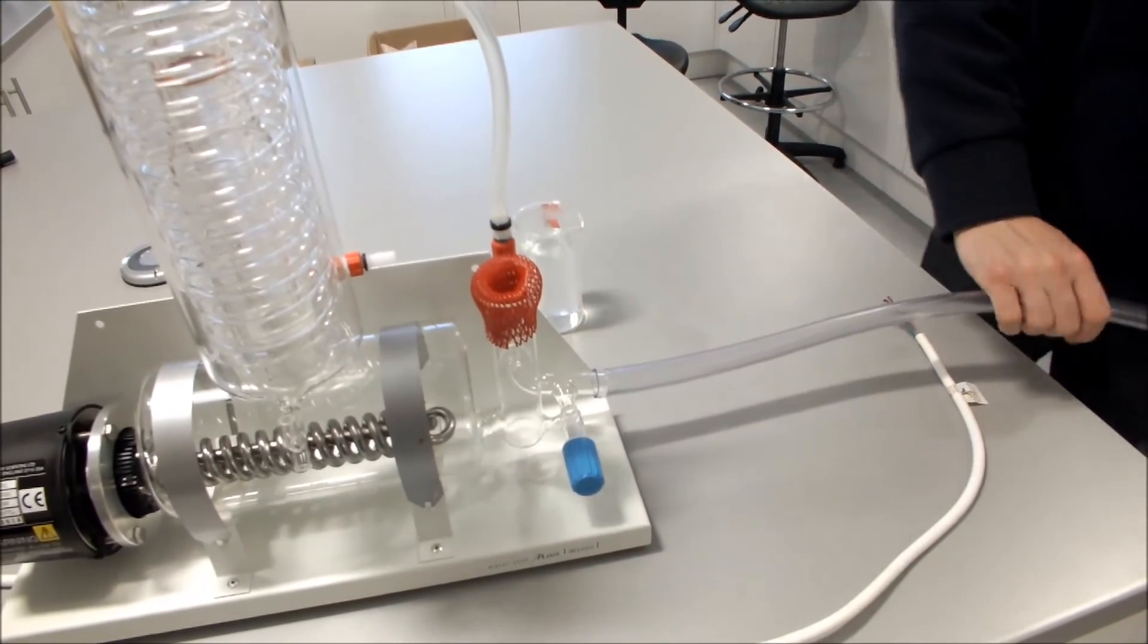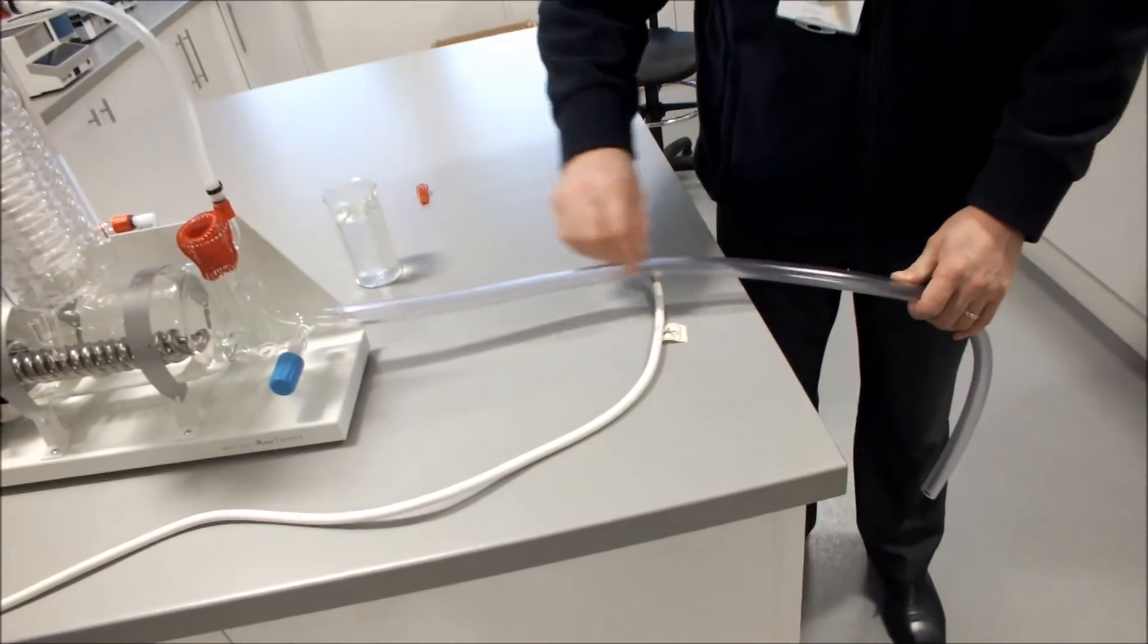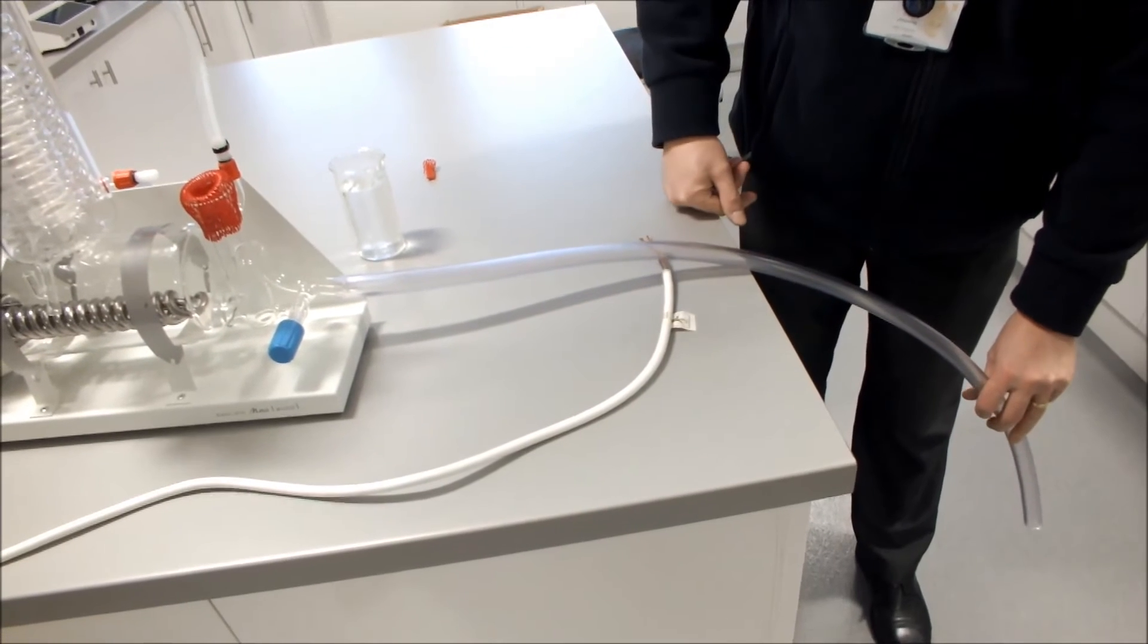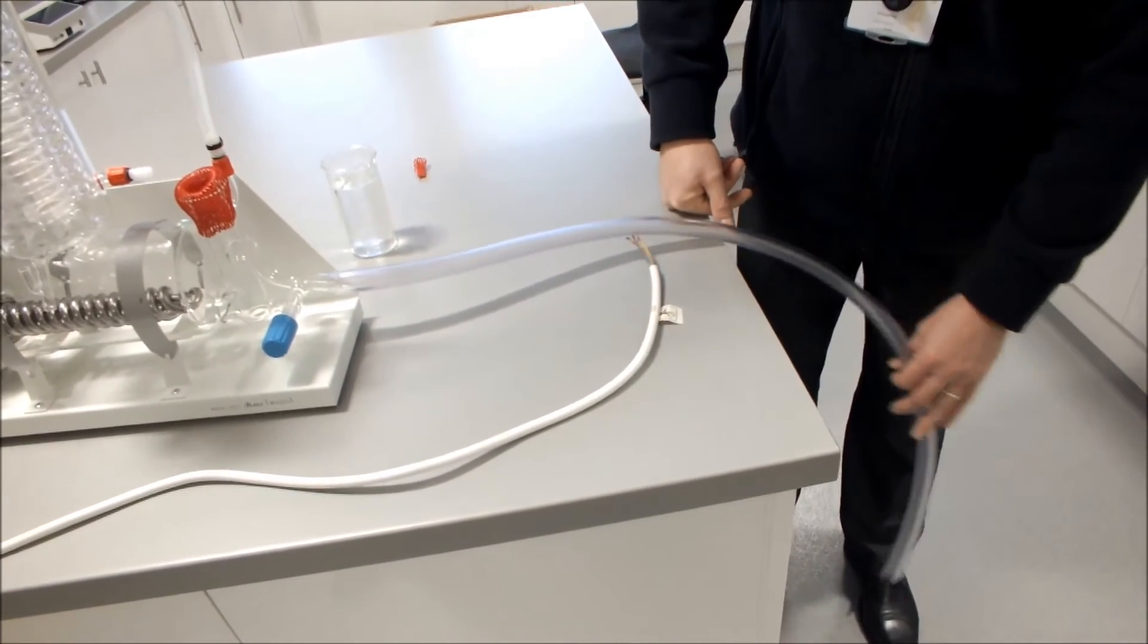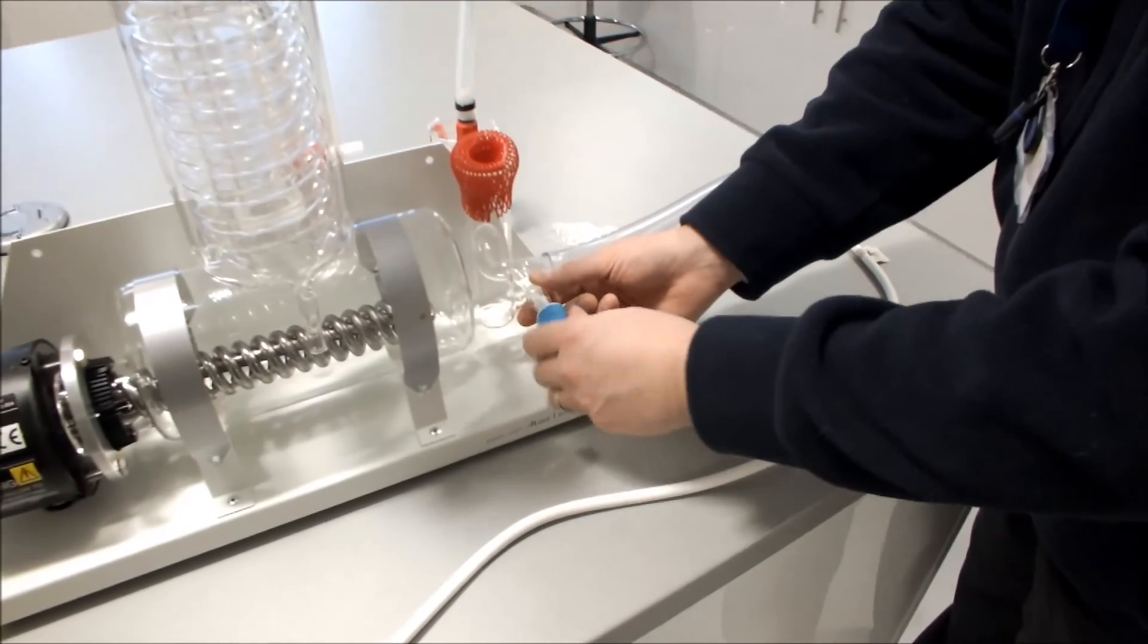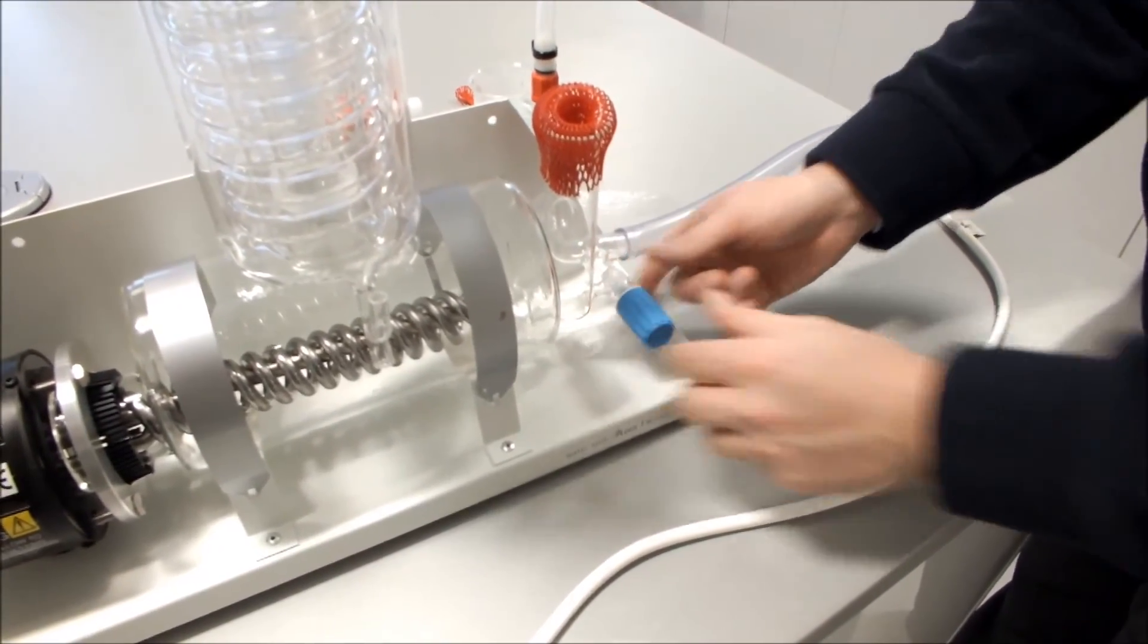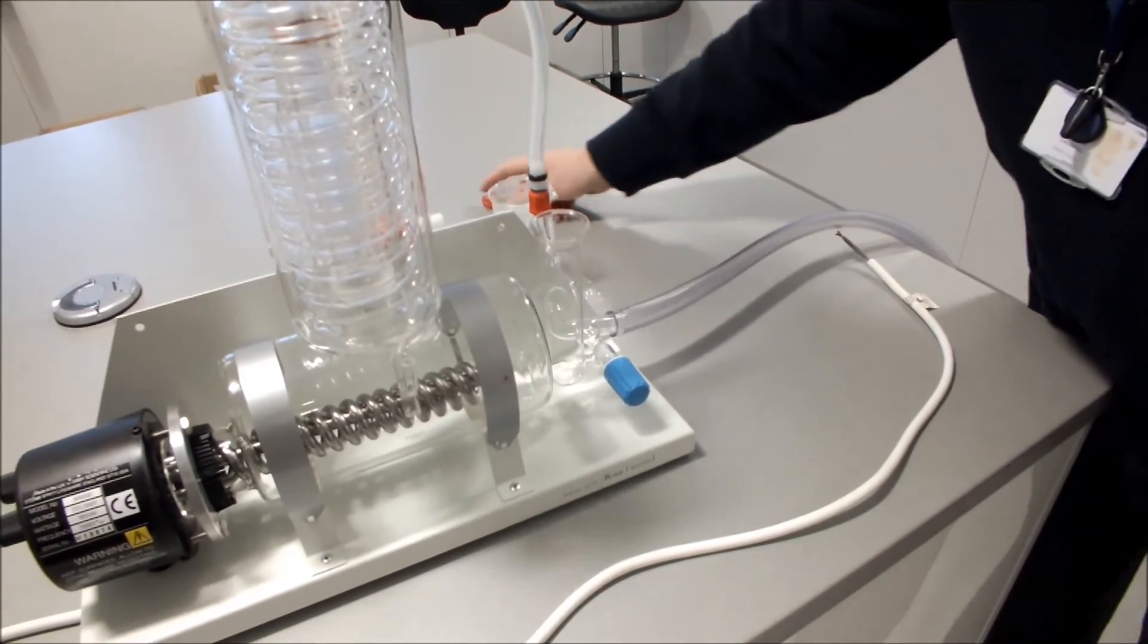The drain, when it leads away from the water still, should ensure that it moves smoothly down away from the water still with no kinks, because you will create problems if you have kinks in the drain. When you've done that, ensure that your stopcock is fully closed and remove any covers, especially the one from the funnel that you may have left.